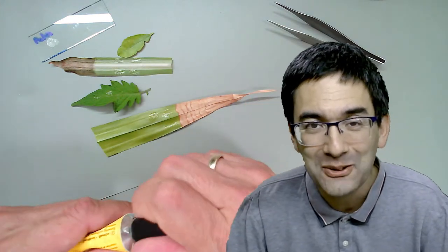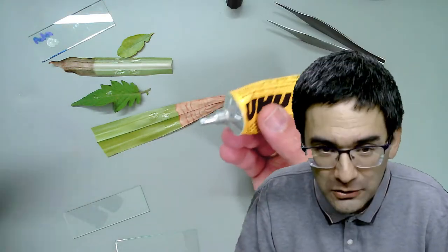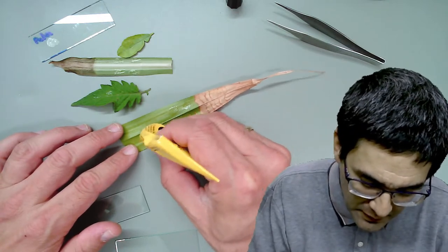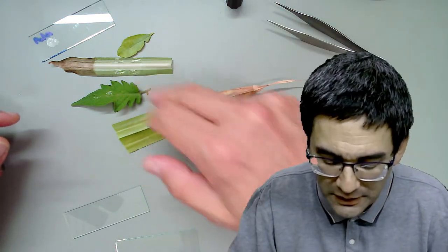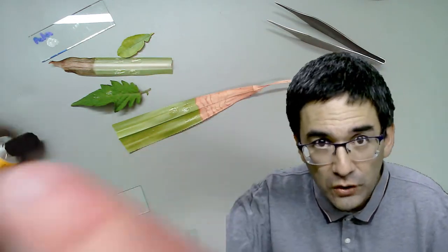Today's livestream might not be very long, but all you do is apply a little bit of glue on the bottom of the leaf, use your finger to spread it a little bit, then let it dry. That's pretty much it, and that's what I've already done here.